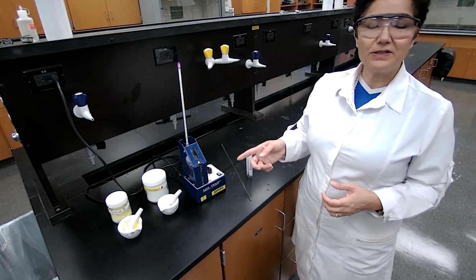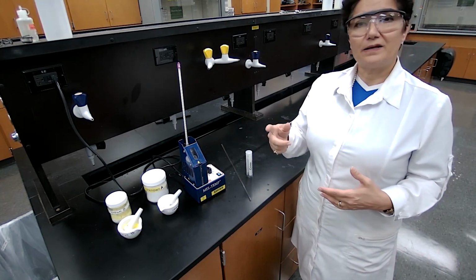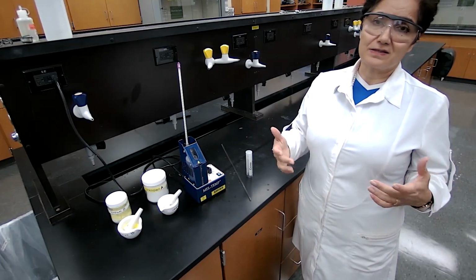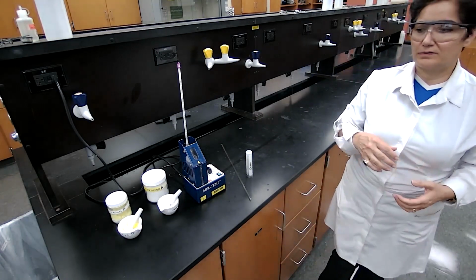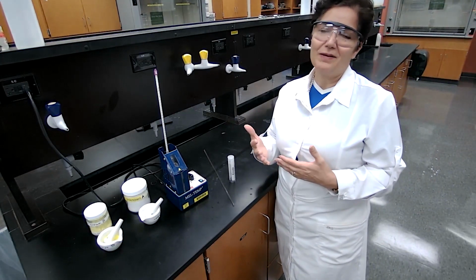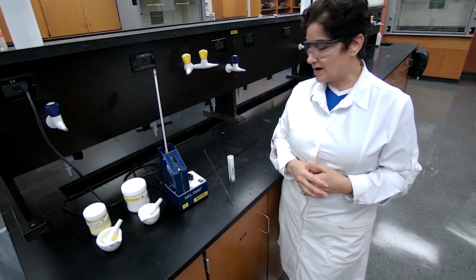After the melting point, we are going to determine solubility to determine the functional group. We follow by classification tests to confirm the functional group if needed, or further analysis or quantitative analysis in order to determine the name. The more information we have, the better the estimate of the physical property, or the better the matching of the physical property to the literature value, and we can determine the name of the compound with greater confidence.